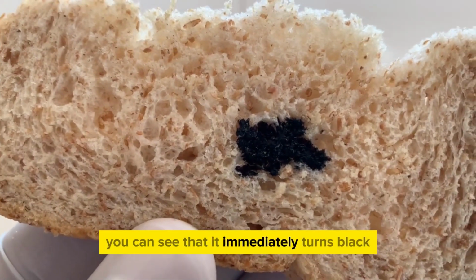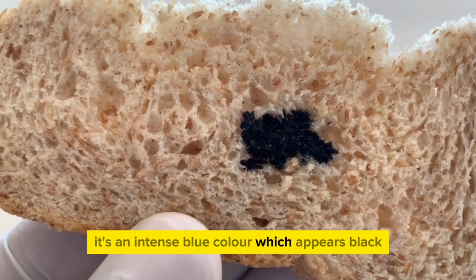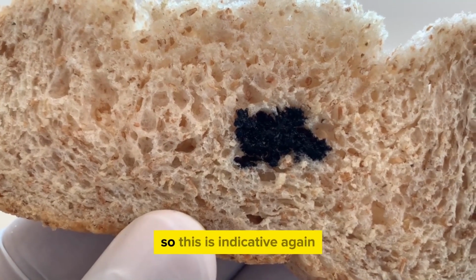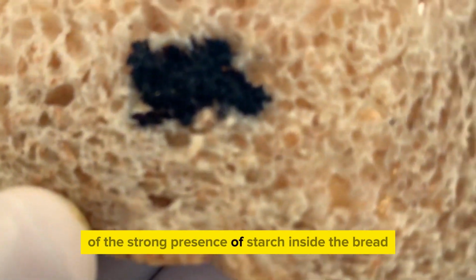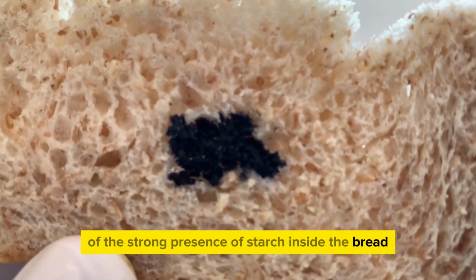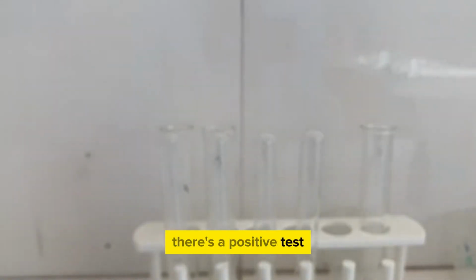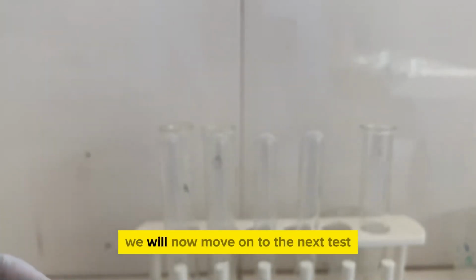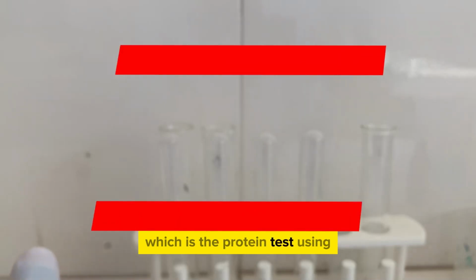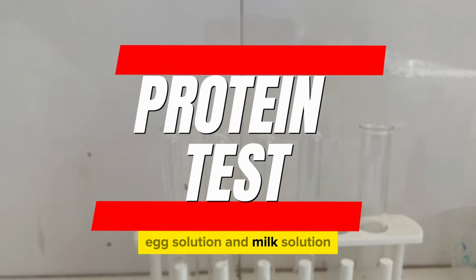You can see that it immediately turns black. It's an intense blue color which appears black. So this is indicative again of the strong presence of starch inside the bread sample. So this is a positive test, and it confirms that our bread does indeed have starch. We will now move on to the next test, which is the protein test using egg solution and milk solution.